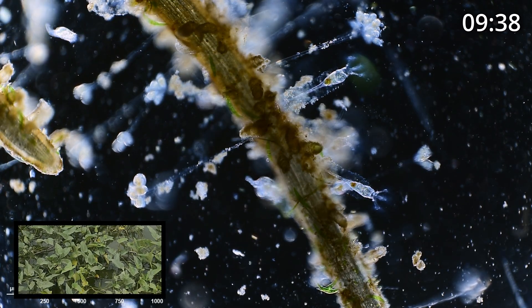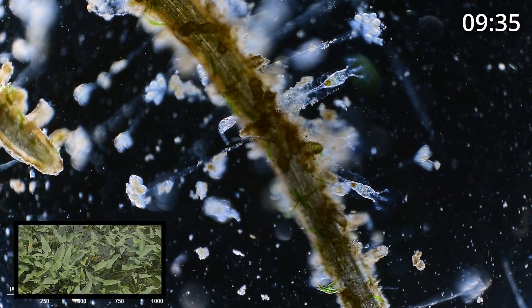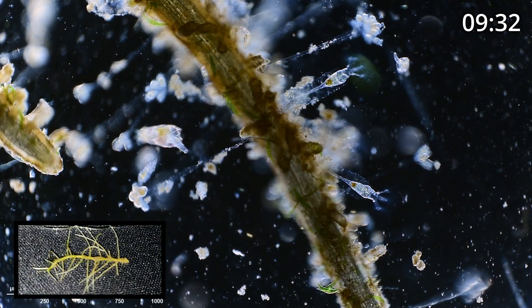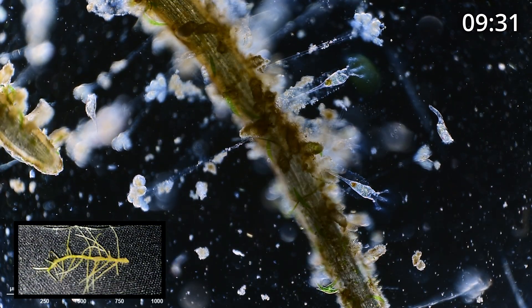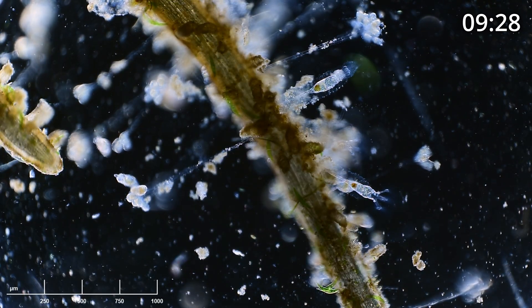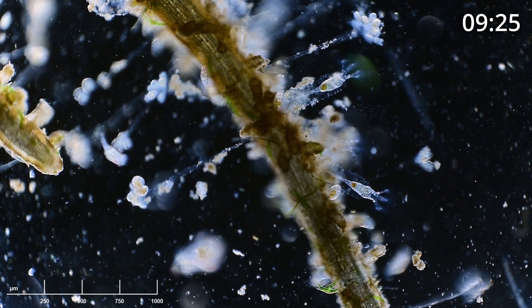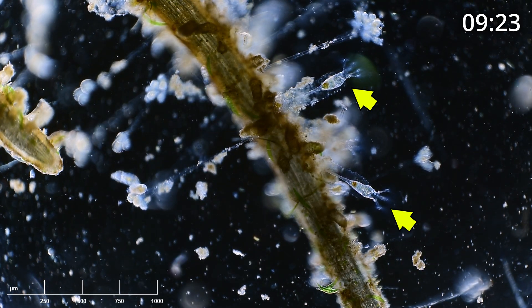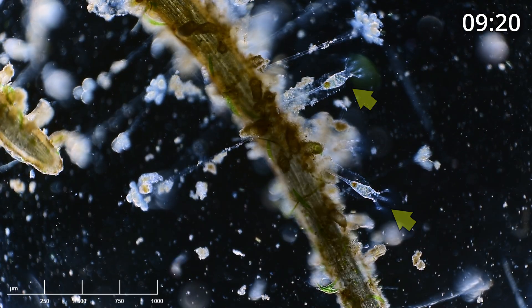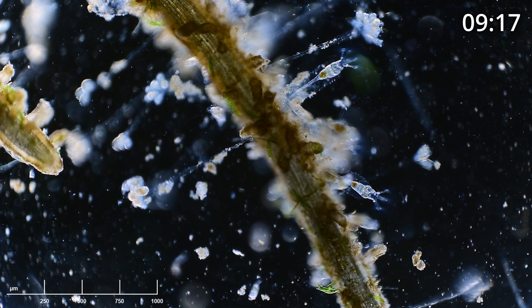This sample is from a local fishing pond here in Bangkok, Thailand. What you're looking at is a root, or a set of roots, from a floating plant in the pond. We're starting out with a really cool view — we've got two colotheca, which are rotifers, beautiful rotifers, attached to the root.